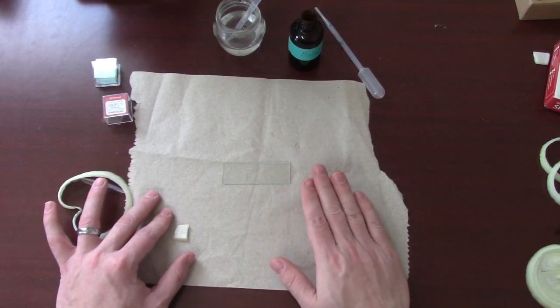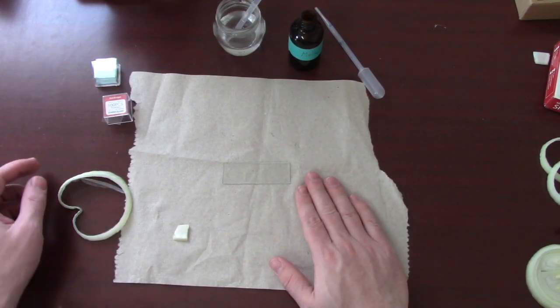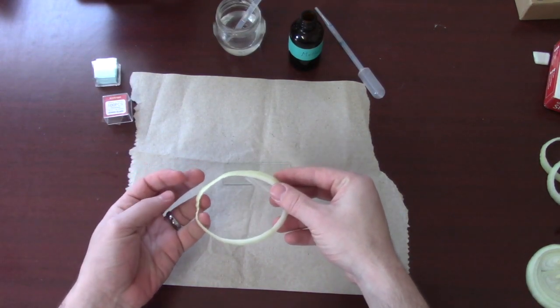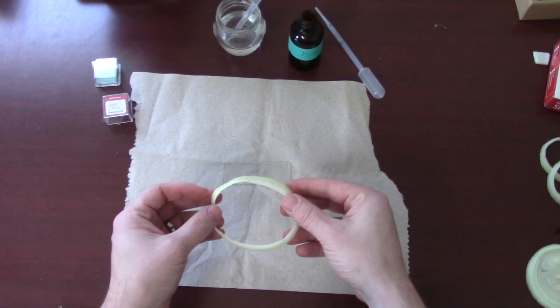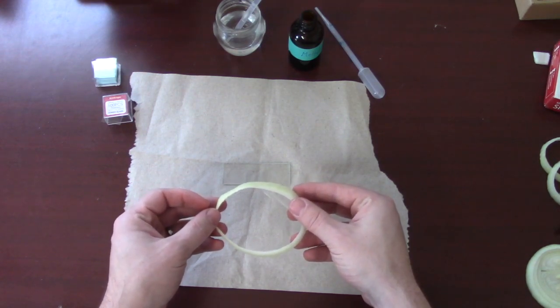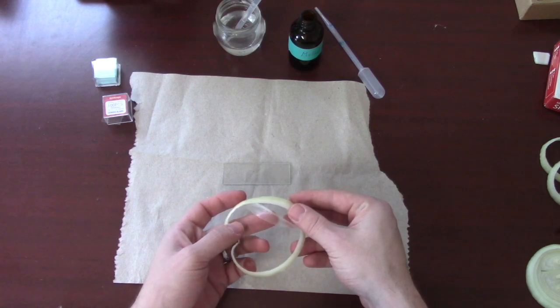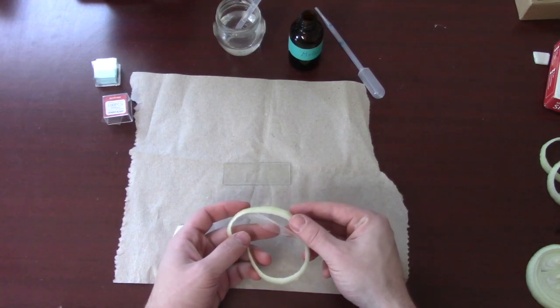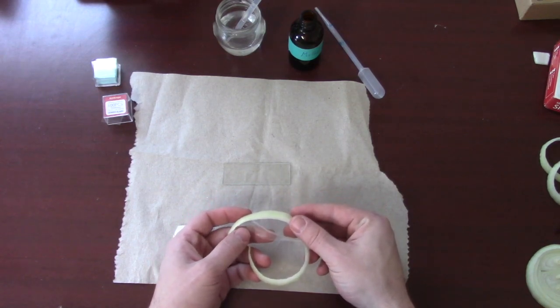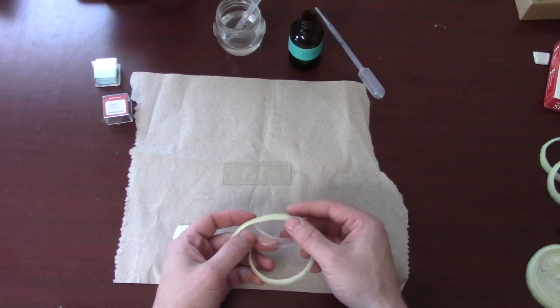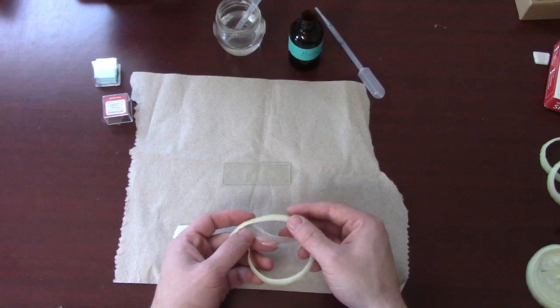Now that I have a clean microscope, I want to get my onion cells. The cells we're going to get are from the inside of an onion ring. So if this is one of the rings of the onion, you can see some of the cells right here. I left this piece of onion sit out for a couple of days and that makes the whole thing kind of fall apart. We want to use fresher onions than that because the cells look nicer, but it is nice to be able to see what you want.